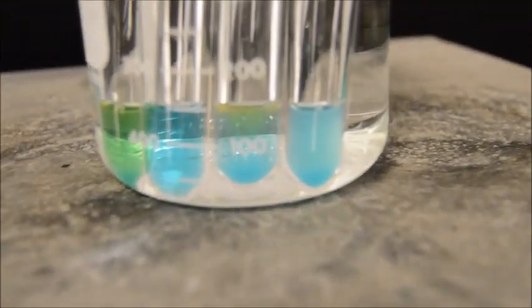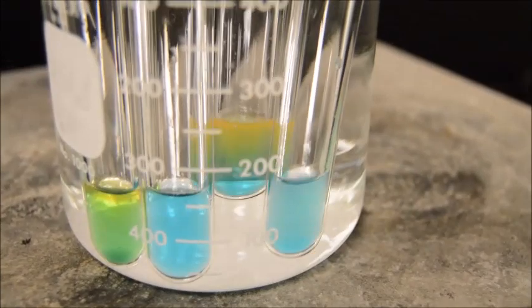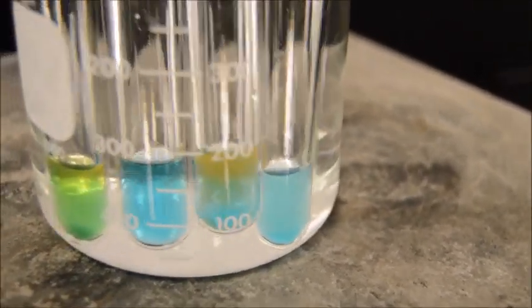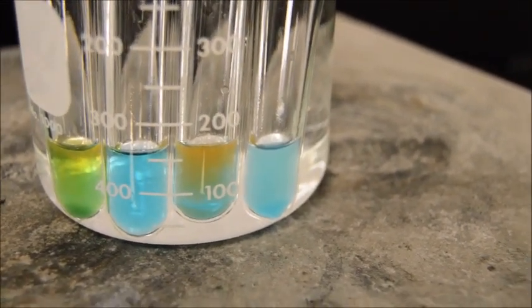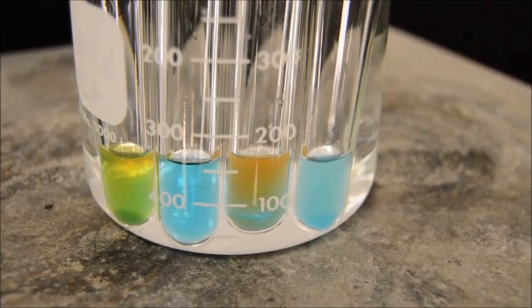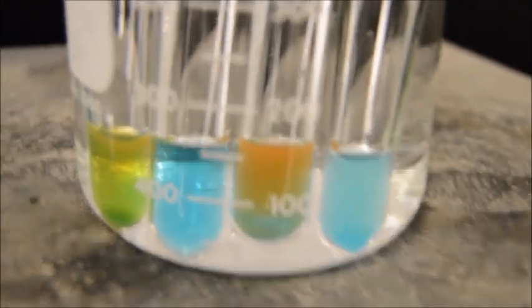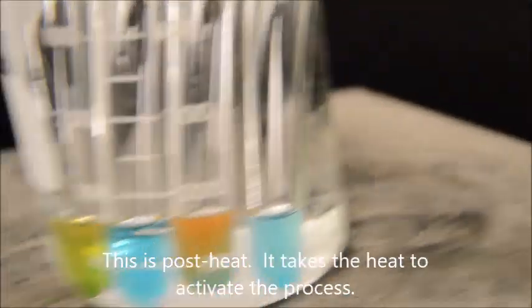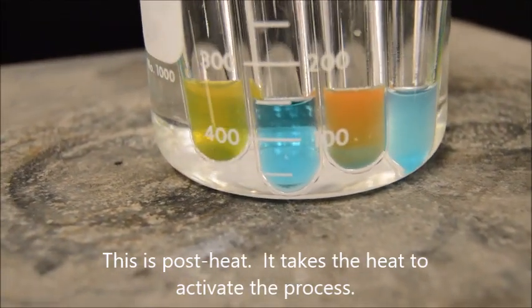Wait a second, what's happening there now? Can you see that test tube shifting coloration? Now that's test tube number 1, which I believe is straight glucose. And Rose, could you remind us what glucose is? Glucose is a simple sugar. We learned that in chapter 3. And this is a test for simple sugars. So look at that amazing color change occurring. I wish you were here to see this in real time. It is really quite an effect. It's almost like a lava lamp. It's just boiling and roiling through.